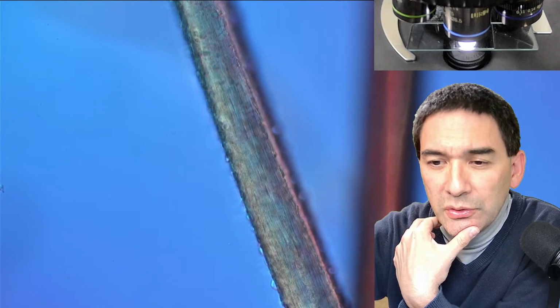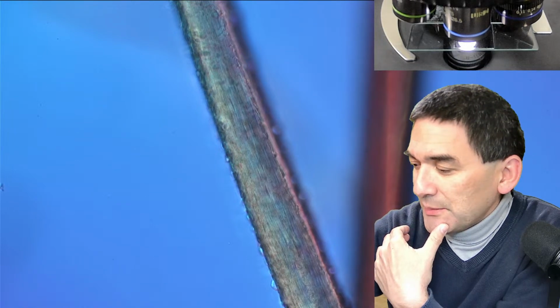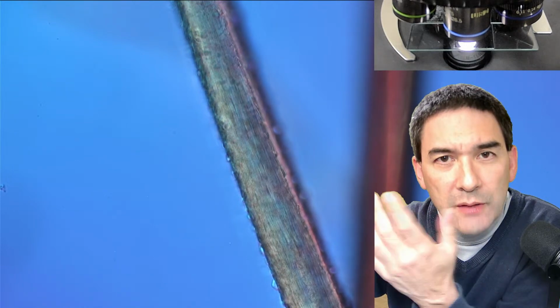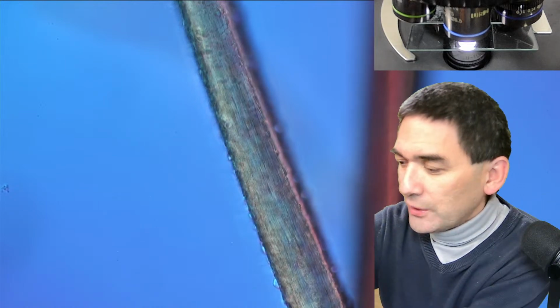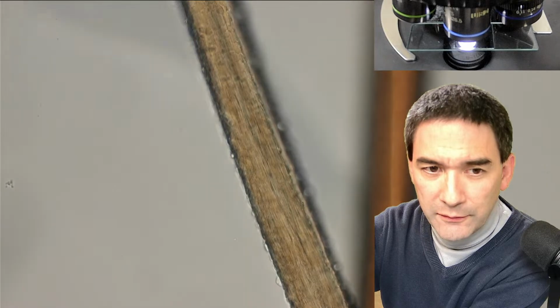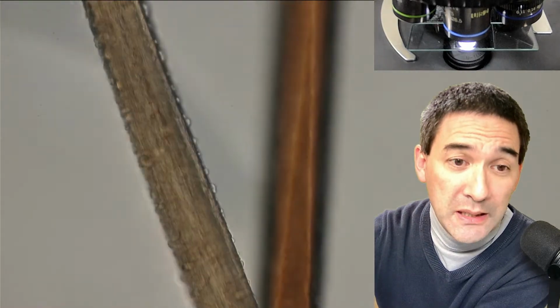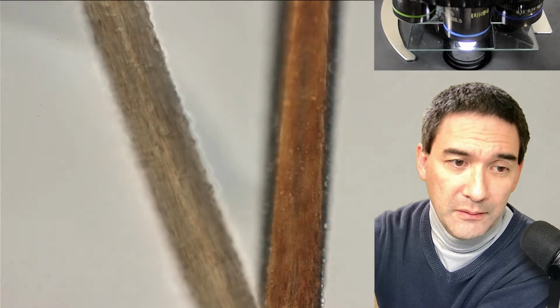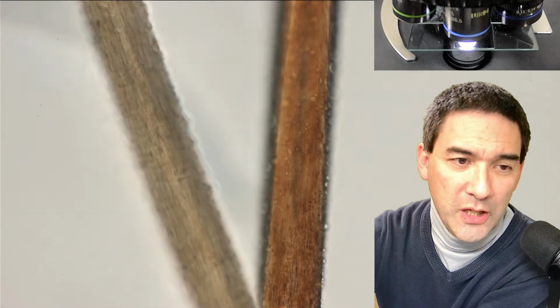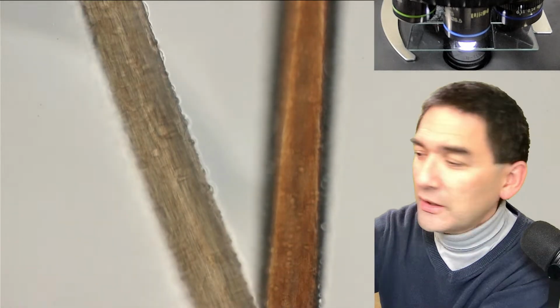With dark field, do you think we can see real hair color? Well, let's put it this way. What you see right now, with the blue background, is because of the filters that I use. When I go into bright field, okay, so this is bright field. That's the way that you would normally see it, and I would probably say that this would be the real hair color. Of course, as you change the brightness around, all the colors also change.